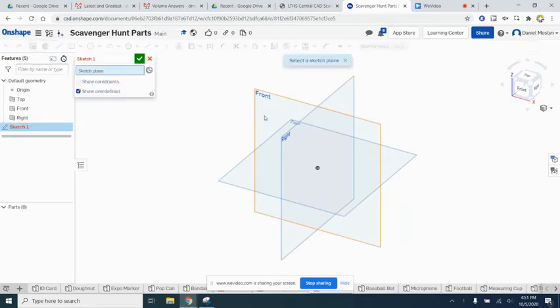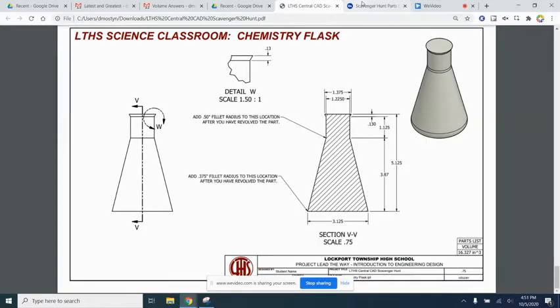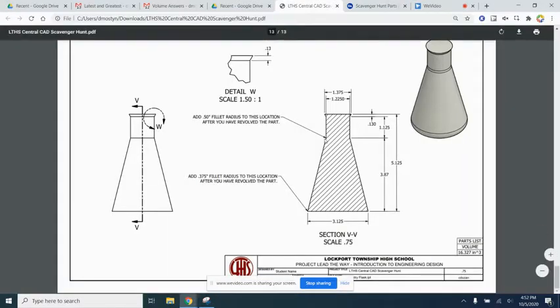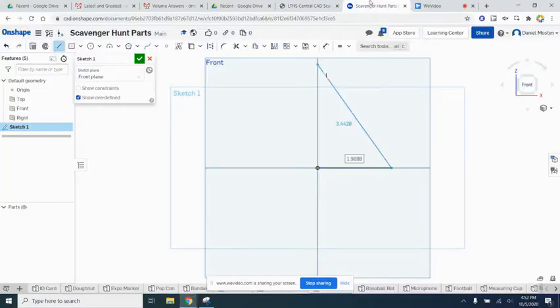Let's choose the front plane to draw on. And we'll start by looking here. Let's start at the bottom and work our way up. So we'll come over here, come out this way to this edge right here. Let's check our dimension. Our dimension is going to be half of this, 3.125. So we'll do 3.125 over 2.